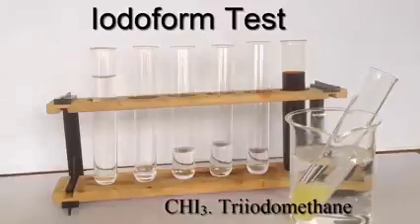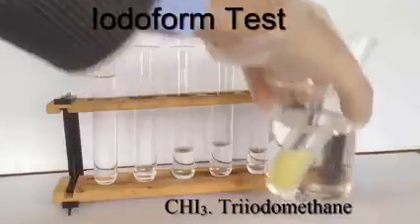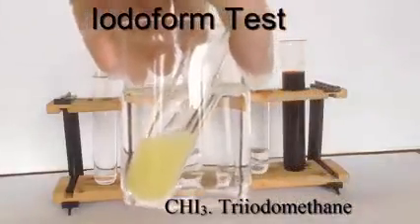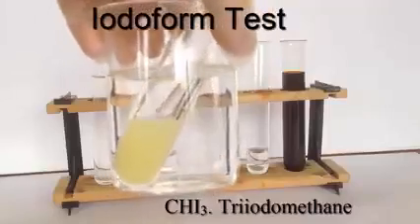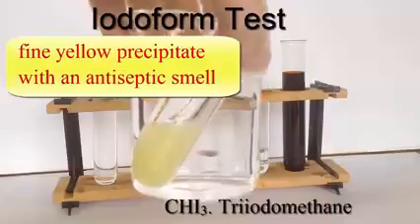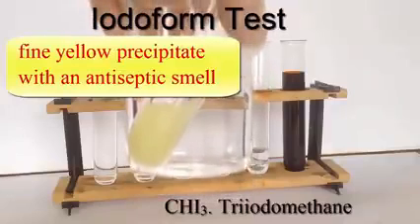This is a positive test because we have produced triiodomethane. In there is a fine yellow precipitate, which you'll see at the end of the video when I filter it using vacuum filtration.